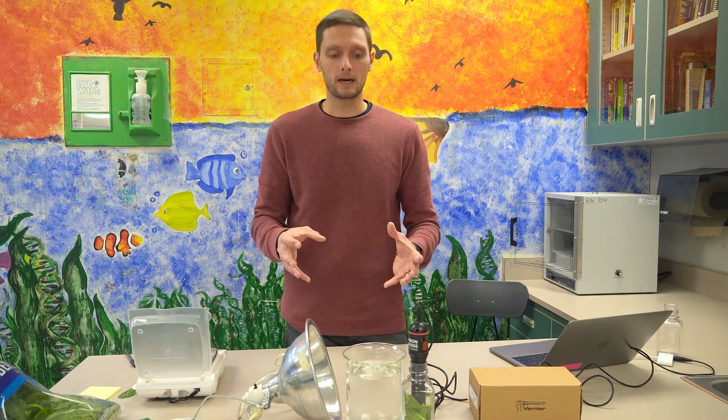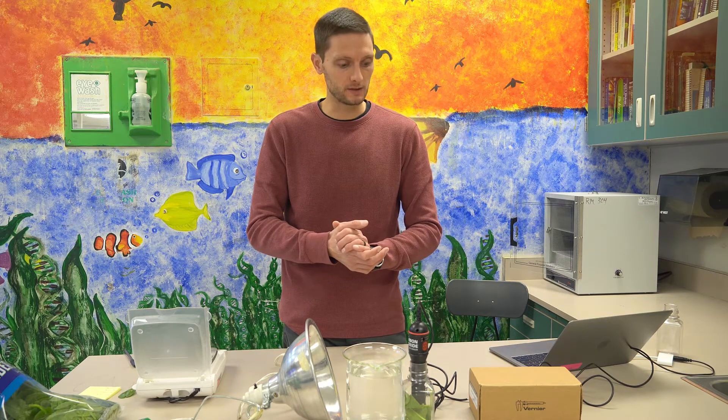Obviously, the biochamber has been open. Now that I've sealed it, I want it to stabilize. So I'm going to let it sit for three minutes while I'm getting other things set up. And we'll come back to it in just a moment.